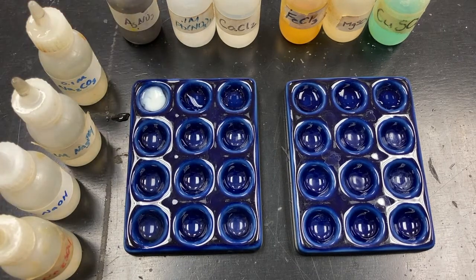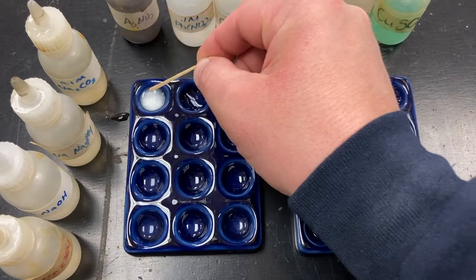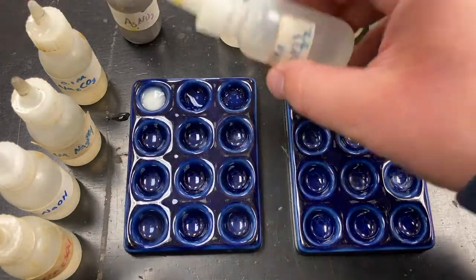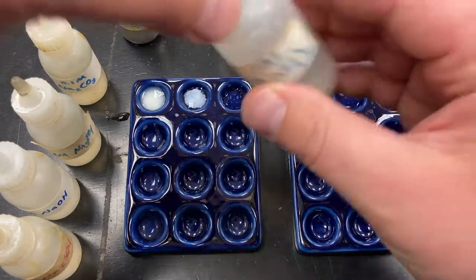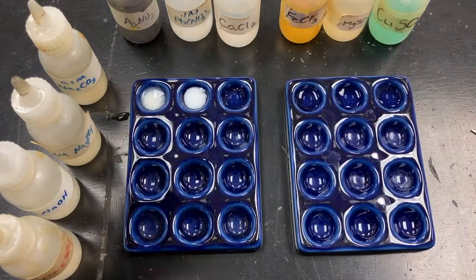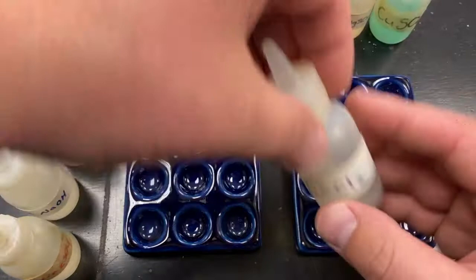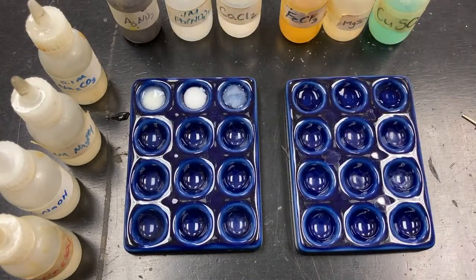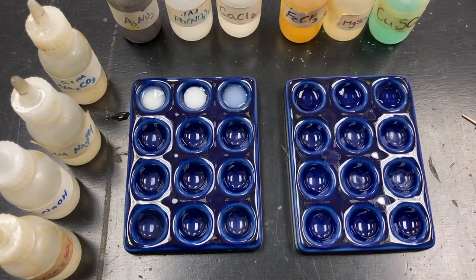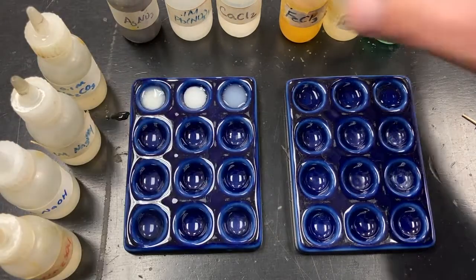So we can see that there is a white solid there, kind of white specks. You can see individual small white specks of solid. Okay. I'll get a close-up of these later. Let's do lead nitrate with the same substance. There's also a white solid, but it's more cloudy. It's more of a white cloudy precipitate. Calcium chloride. Okay, very slight, but there is kind of a hazy, tiny little white specks. So it looks like carbonate must like to make white precipitates. Let's see if that continues.